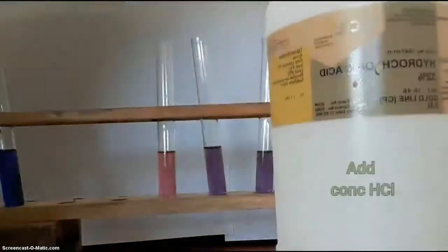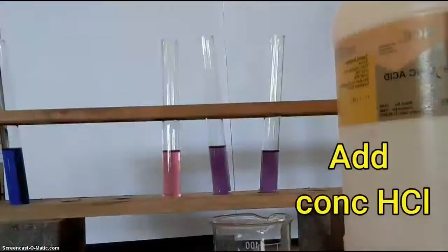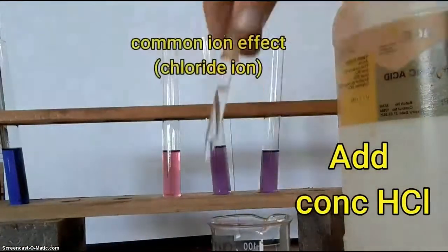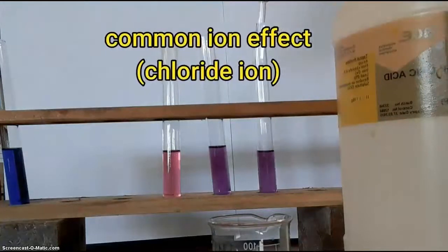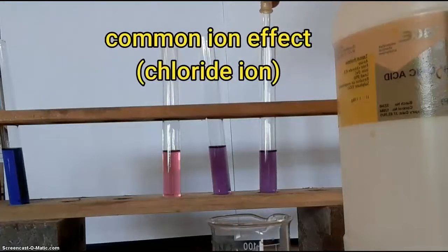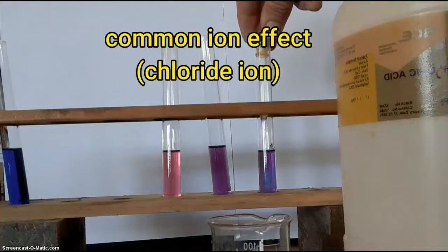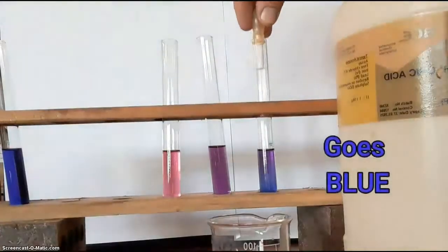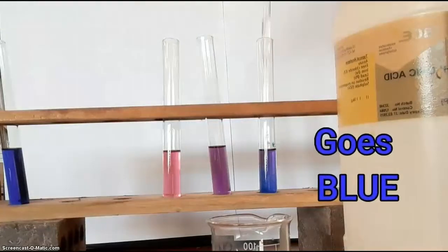To the one on the right, we're going to add some concentrated hydrochloric acid. The acid has H plus ions plus chloride ions, and the chloride ion is the common ion in this case. And again we see it go blue.